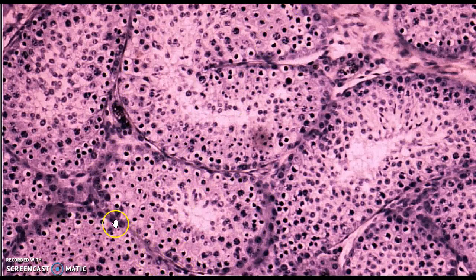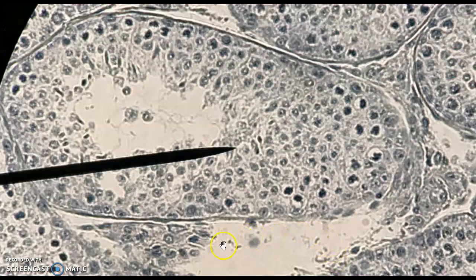So these cells that are forming the sperm-blood barrier are called Sertoli cells, and they protect the haploid cells in here from being attacked by the white blood cells, and they do also help maturation as well. So here's a stain, not as much color, so we have the Sertoli cells there and there. And then all of these cells are ones going under meiosis.